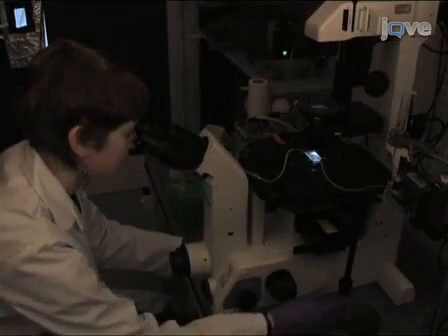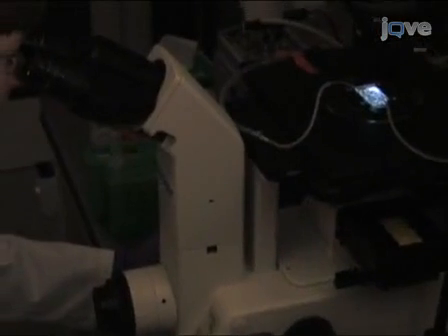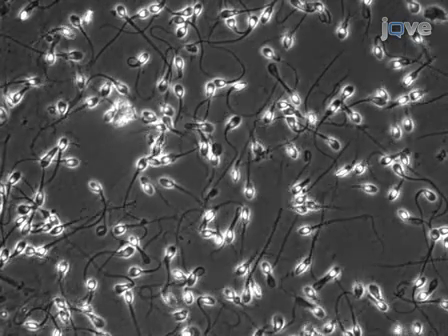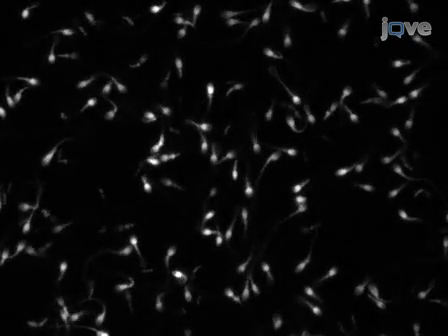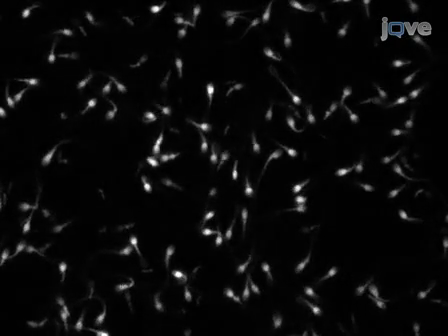Under phase contrast at 40x or 60x magnification, choose a field of view where cell spacing is sufficient to permit fluorescence from each cell to be assessed separately. Cells should be adequately attached, but preferably exhibiting clear flagellar activity. Switch the microscope to the green fluorescent channel. Keep exposure times at the minimum required for a clear fluorescent image to reduce photo-bleaching.